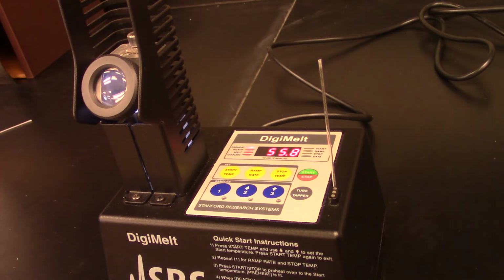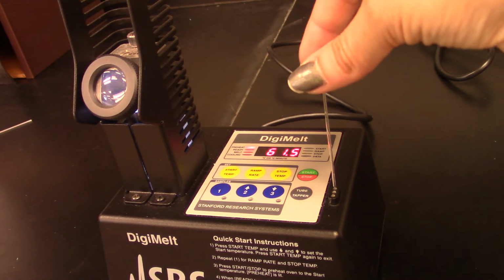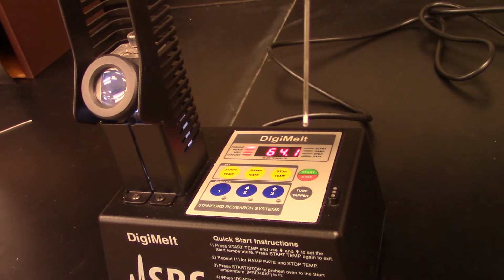Okay, now that you have your compound loaded into the melting point tube, you just need to take the tube that's got the solid down in the bottom, and you need to put it into the heating block. Now the heating block is right over here behind this viewport, and it's difficult to see, but there are 3 little slots right here that can each accept a melting point tube. So I'm just going to put this one into the middle slot and drop it down, and it is going to be nearly impossible from this camera to actually see what's going on inside that viewport.